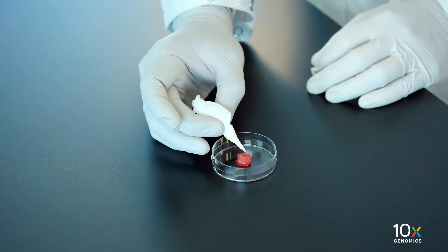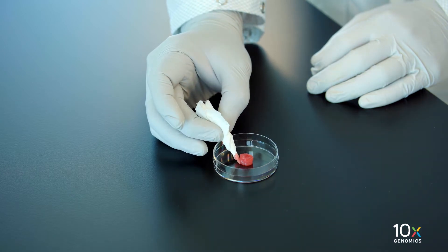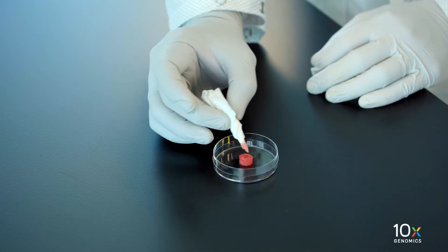Next, we will prepare the fresh tissue. Using a rolled up laboratory wipe, absorb excess blood or solution from the surface of the tissue to limit ice crystal formation.